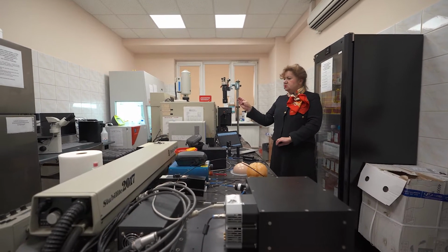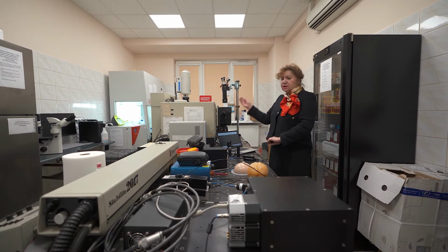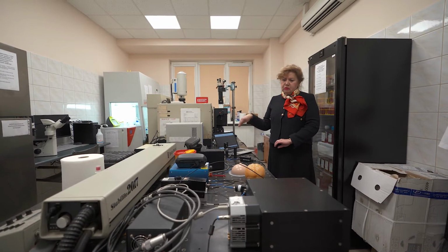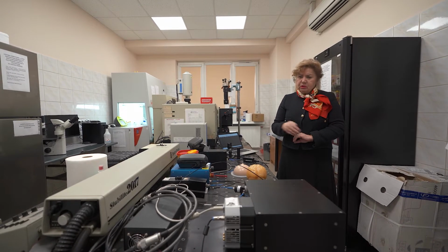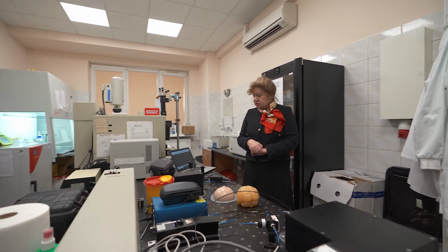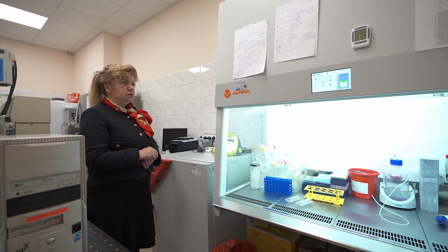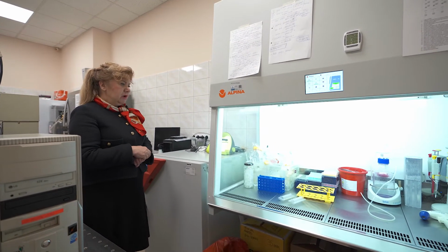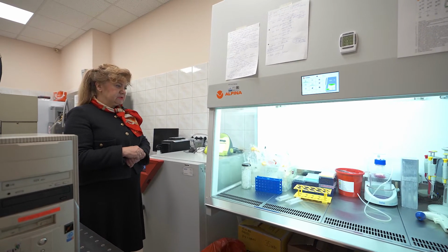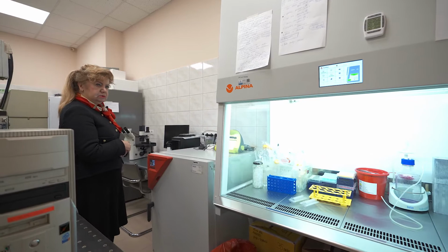Our third laboratory is the laboratory of Raman spectroscopy. The system consists of a conventional Raman spectrometer with cryostat and a handheld Raman spectrometer for cancer research, for brain, breast, colon, stomach measurements. Additionally, we have the system for in vitro incubation, a single cell system for incubation with drugs and vaccines. The system consists of a laminar chamber and incubator.